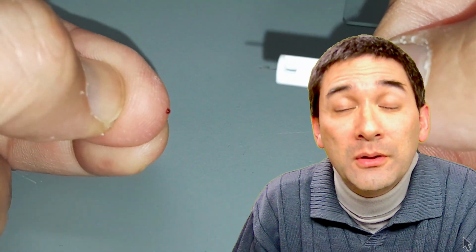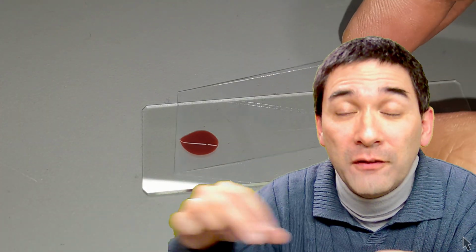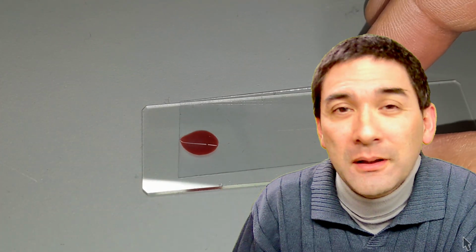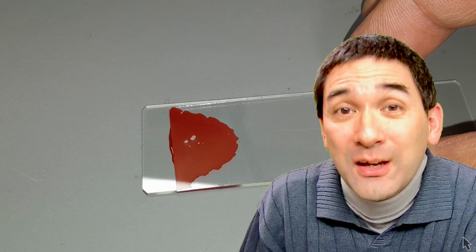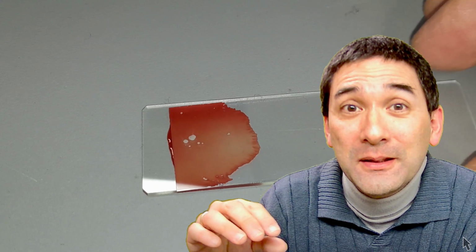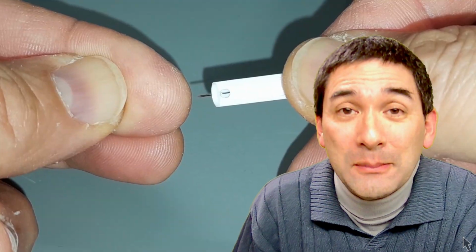Normally when you put the blood under the microscope, what you do is you let it dry in the open air, you streak it out on the slide, and then you have a thin layer of blood on the microscope slide. But I'm not doing that because I want to make sure that the blood actually remains liquid so that I'm able to see the movement of the white blood cells, and of course also the streaming motion of the red blood cells.